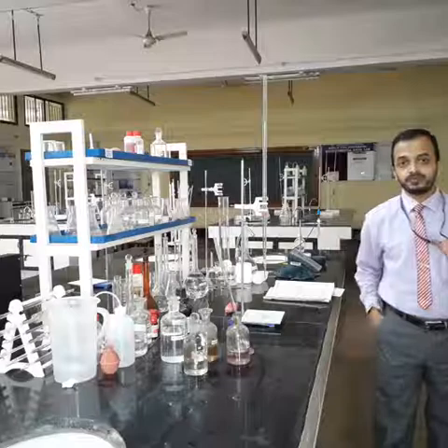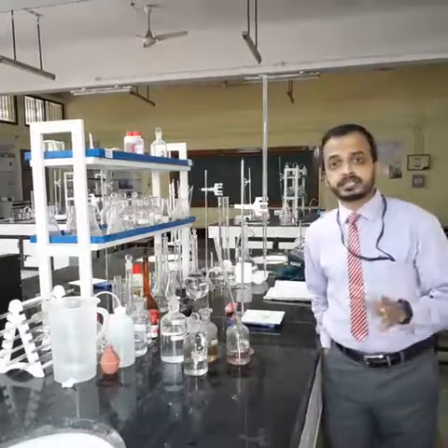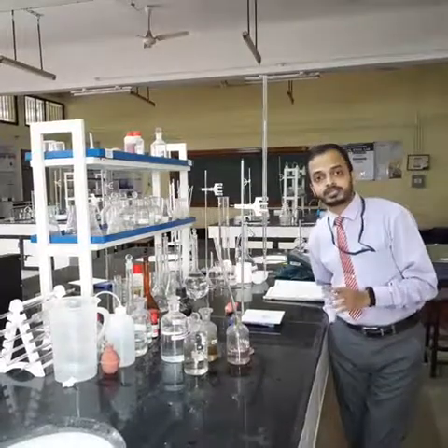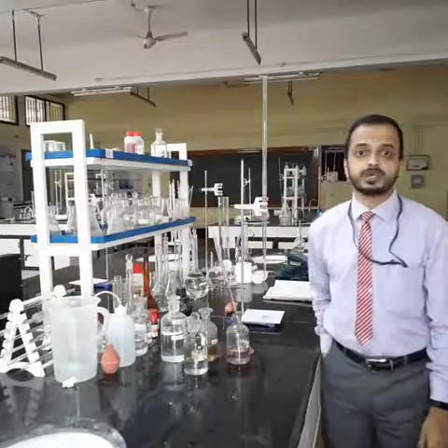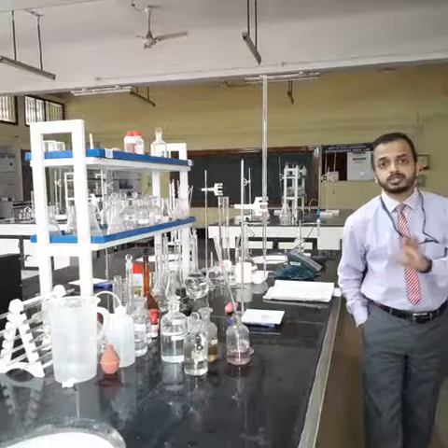So you need to find out the dissolved oxygen in the water or a given sample at a standard temperature and a standard pressure. The standard temperature we take as 20 degrees Celsius as per the Indian climatic conditions, and the pressure we take as 1 atmosphere. So this is about the dissolved oxygen.